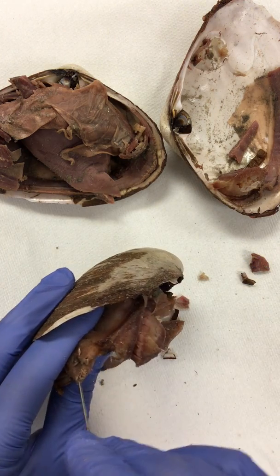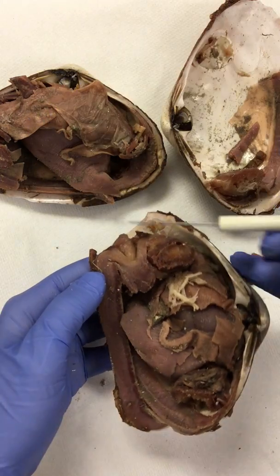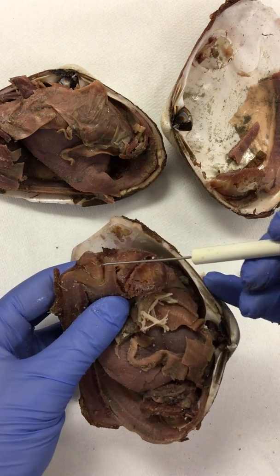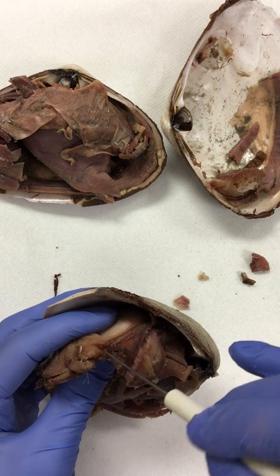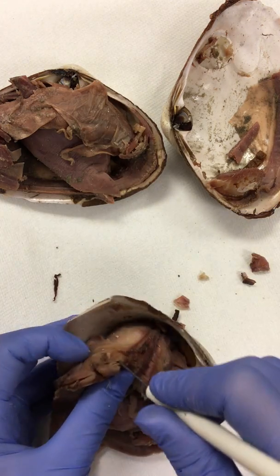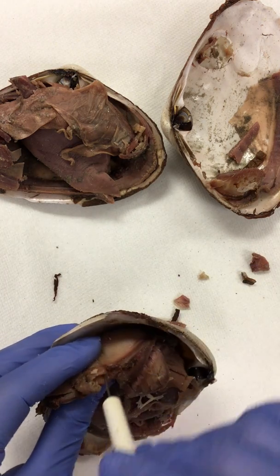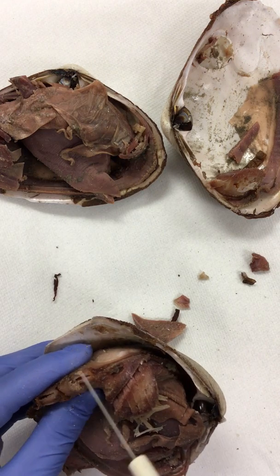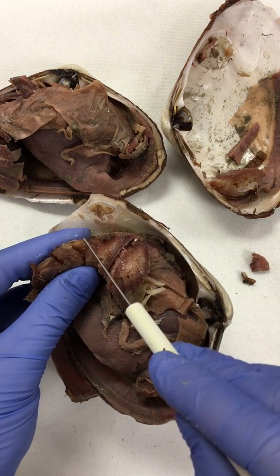So this is the in-current siphon that I've inserted the probe into, and we know it's the in-current siphon, which is this structure right here, because it's closest to the ventral region. Next to the in-current siphon is the ex-current siphon, and it's also known as the exhalant. So those two words are used: in-current and inhalant, or ex-current and exhalant. So this right here is the exhalant siphon. The ex-current is more dorsally located, and this is where waste is going to exit.